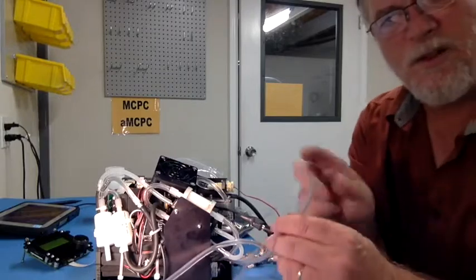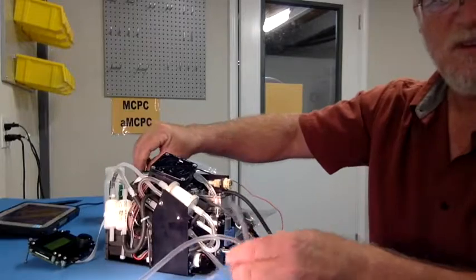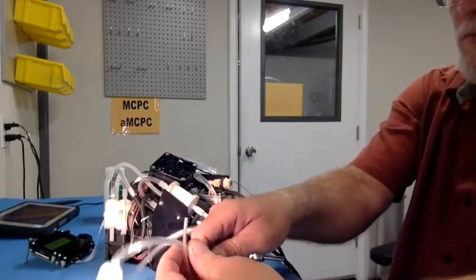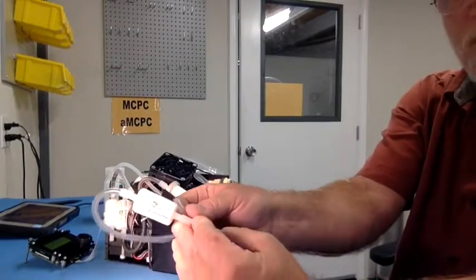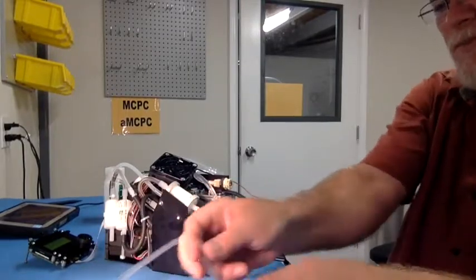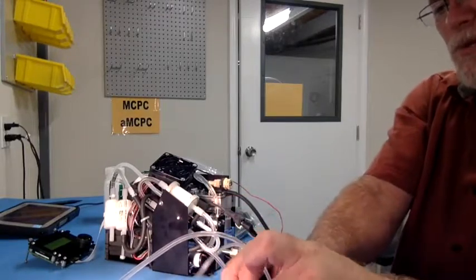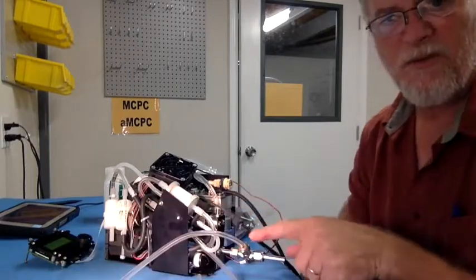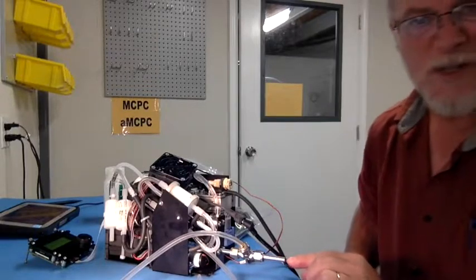And then what can happen is if you tie the saturator pump inlet that I described earlier to this tube here, you can hook it right to the barb fitting, you can pull this off and hook it right to the filter. The idea is that this will let the saturator pump pull its inlet flow from this T. There's a mixing orifice at this entrance.